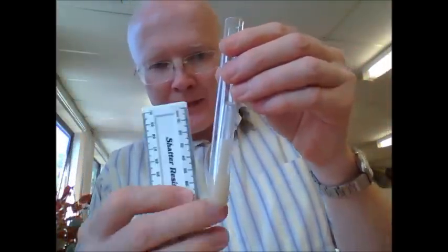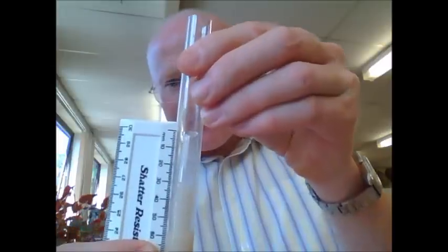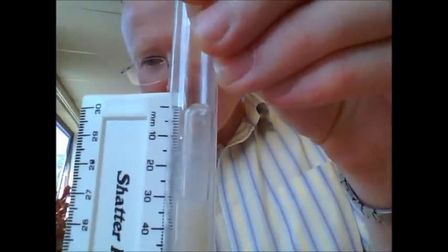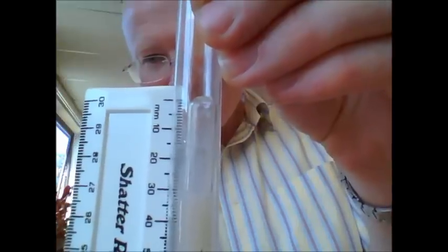After 10 minutes, remeasure the height of the bubble in each of the tubes, which hopefully you can see here. That's around about 33 millimeters. Do the same and then measure each of your other tubes.